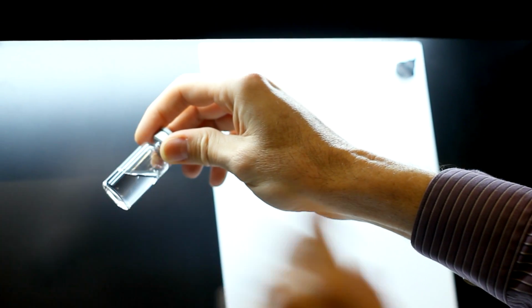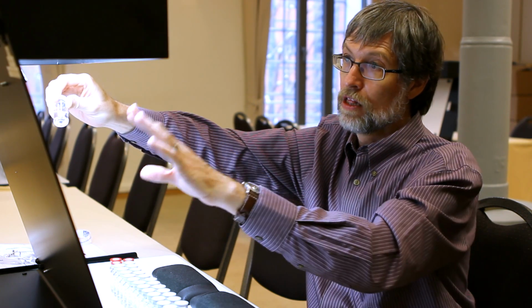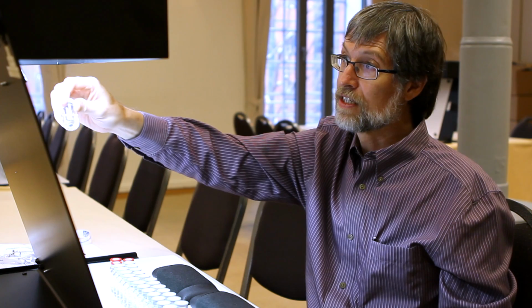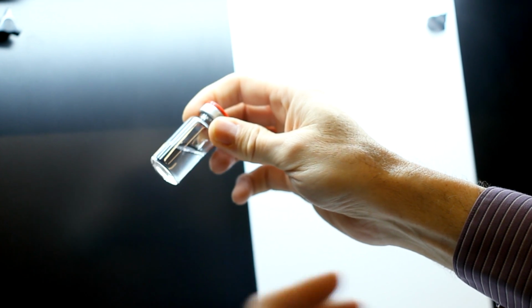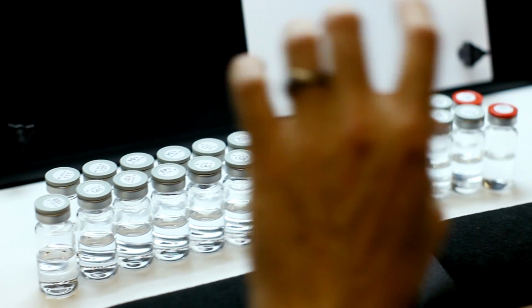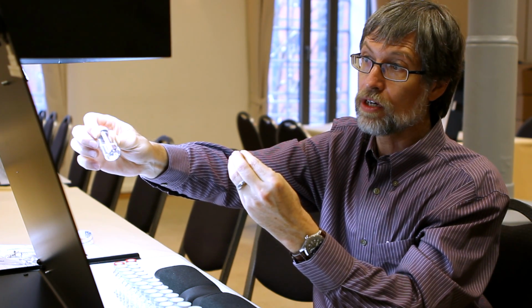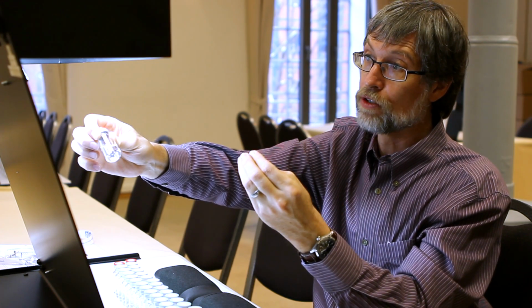And we look for 5 seconds against a black background, and then we agitate and look for 5 seconds against a white background. So we can see both light and dark colored particles against this standard inspection. And we do this for an entire set of vials. We have some that we have prepared that are easier for the students to see, so they can start with something easy to see, and then we work toward more difficult ones. And then from that, they can go ahead and learn how different particles look and discriminate against, say, air bubbles if they're having difficulty with the agitation. And you can see some air bubbles here.